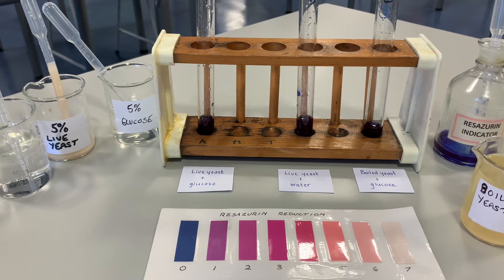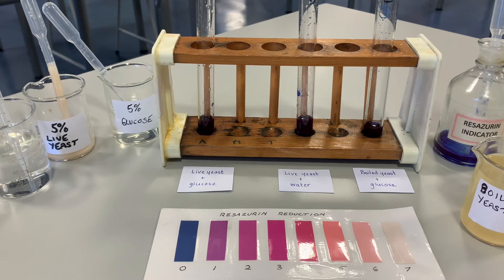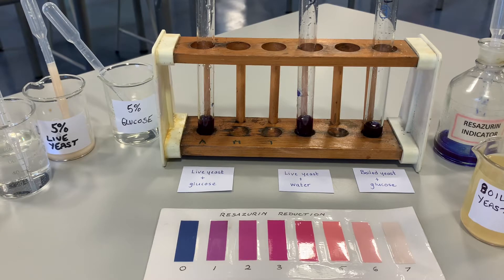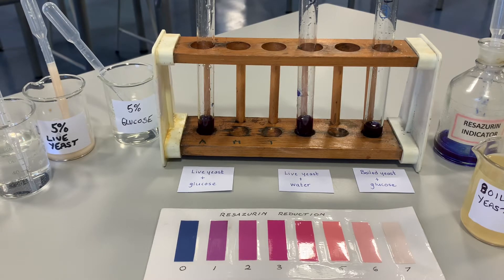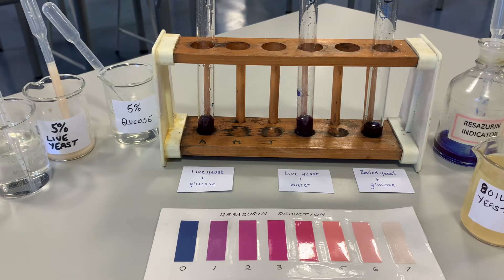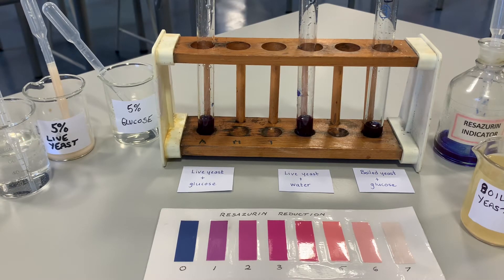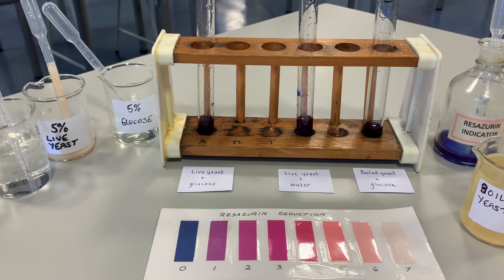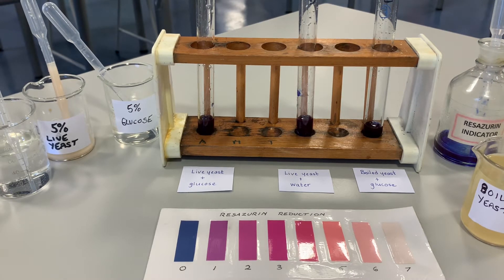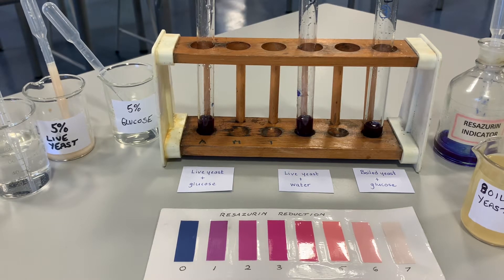We're going to use yeast because it's a living organism and therefore it carries out respiration, so it has a dehydrogenase enzyme. In my test tubes I have put resazurin indicator. What that does is it changes color in the presence of hydrogen — it starts off a really dark blue color, and as the hydrogen content increases it goes through a range of colors from purple to pink.